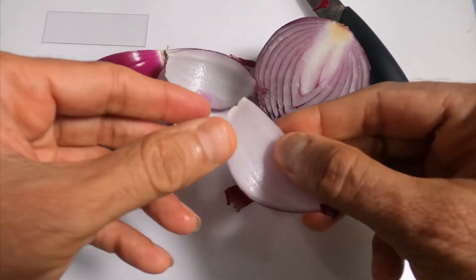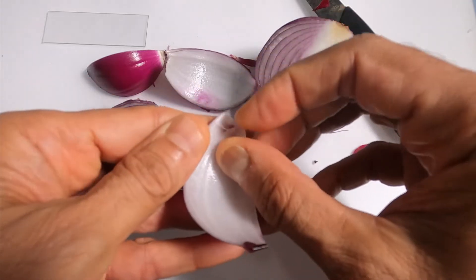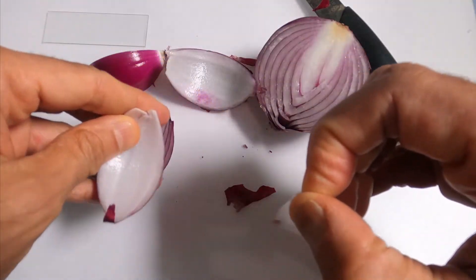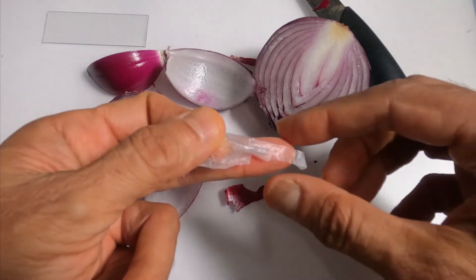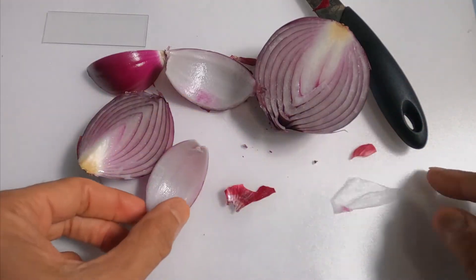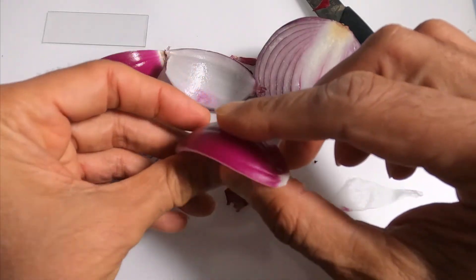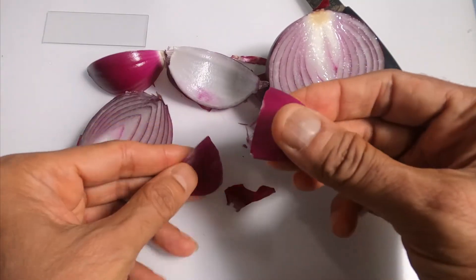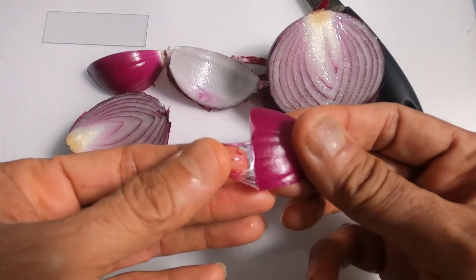There's a concave side of the onion leaf from which you can remove an epithelial cell layer. That's very easy to remove, but this layer is three or four cells thick, so this is not what we want to observe under the microscope because the cells will be layered one above the other. We want a film from the convex side, the shining side of the onion leaf. We break it like this and remove the film from the shining side, which is only one cell thick — and that's what we want to observe under the microscope.